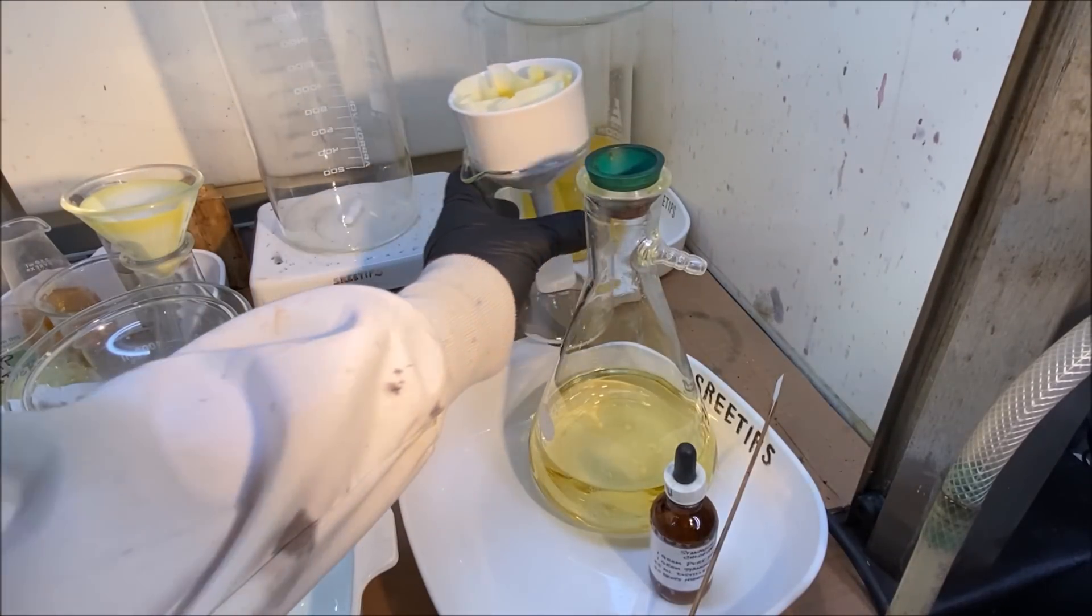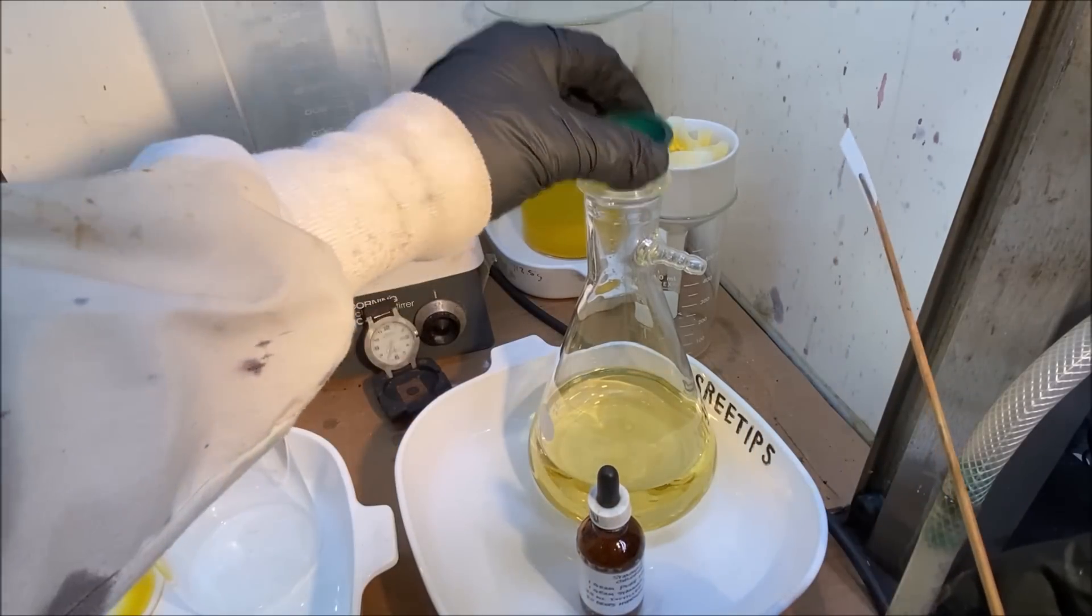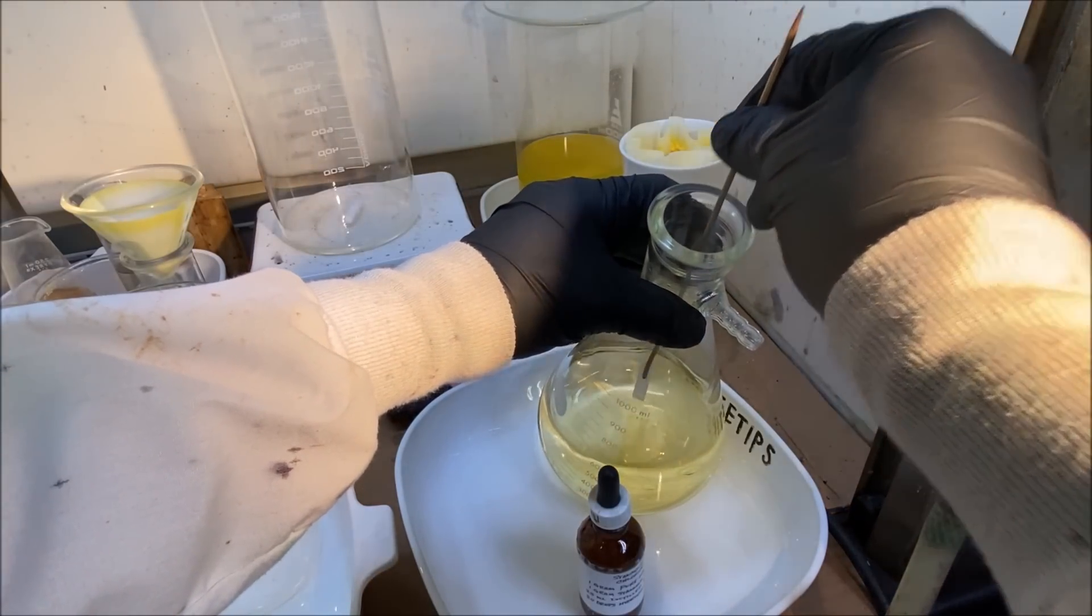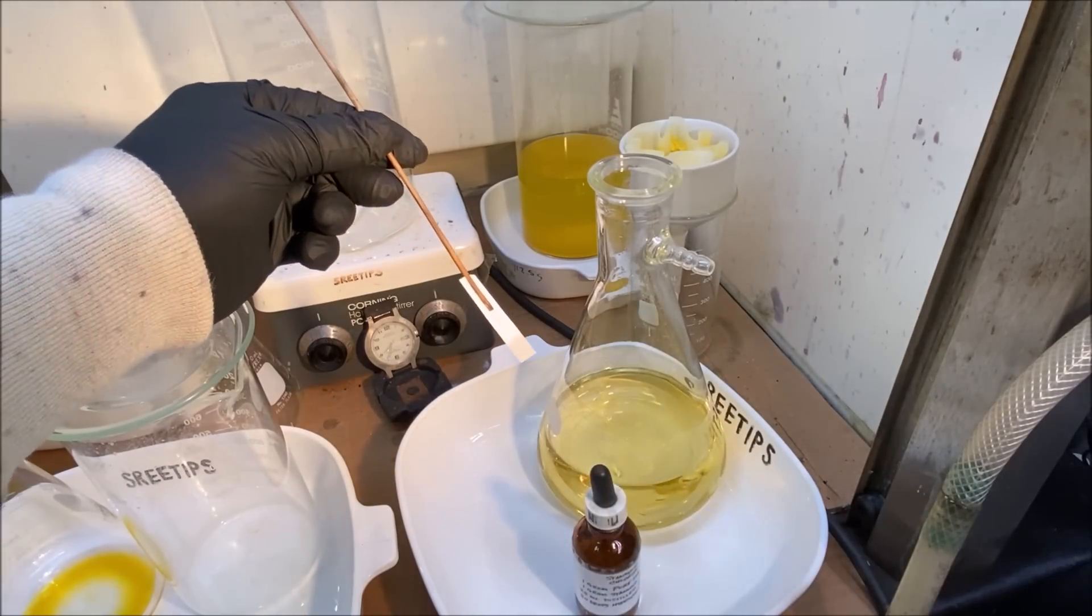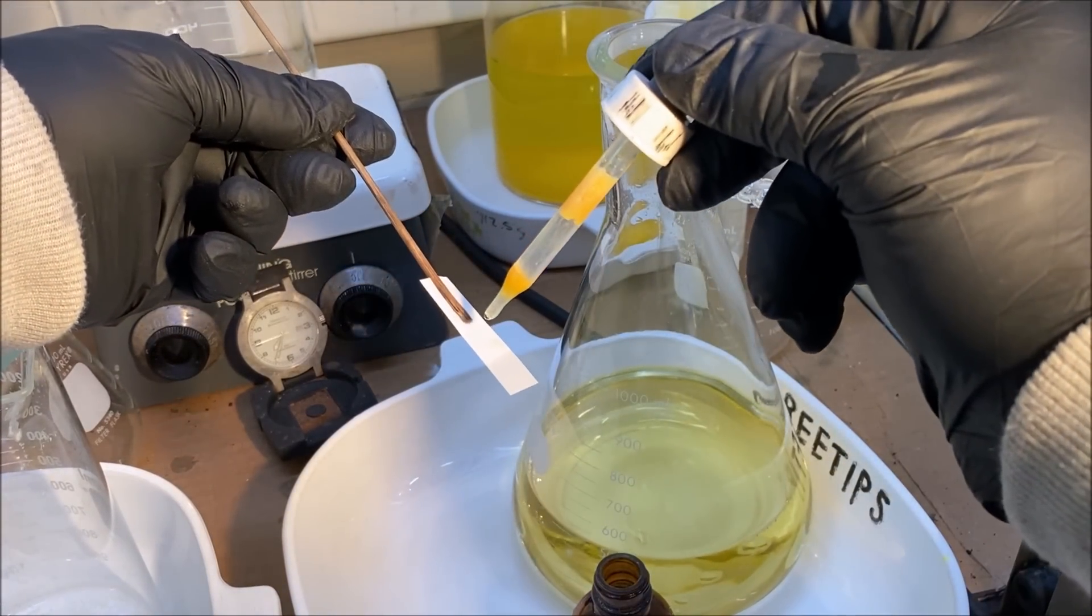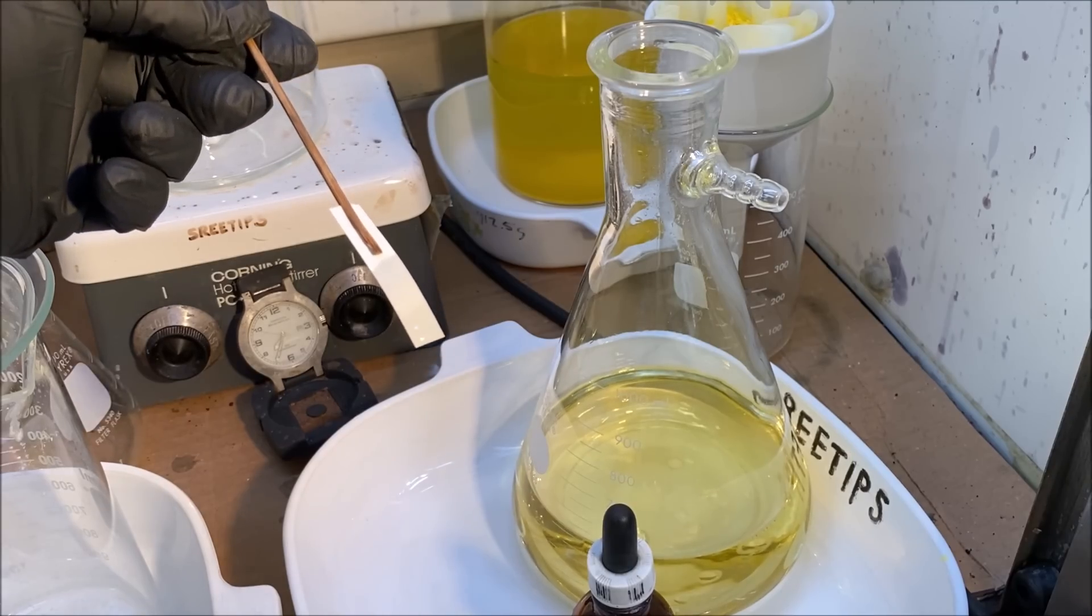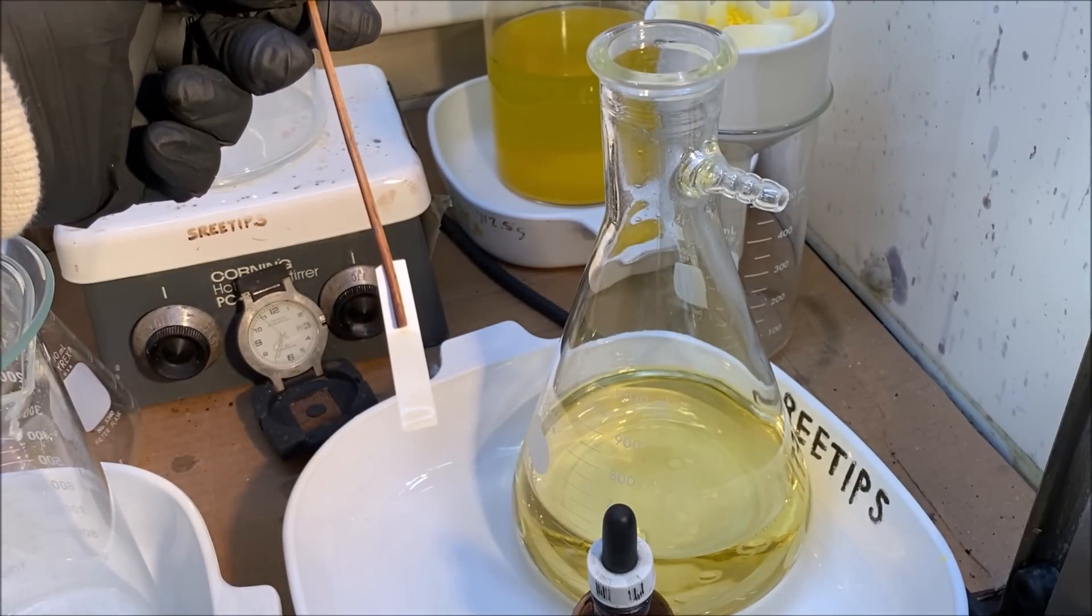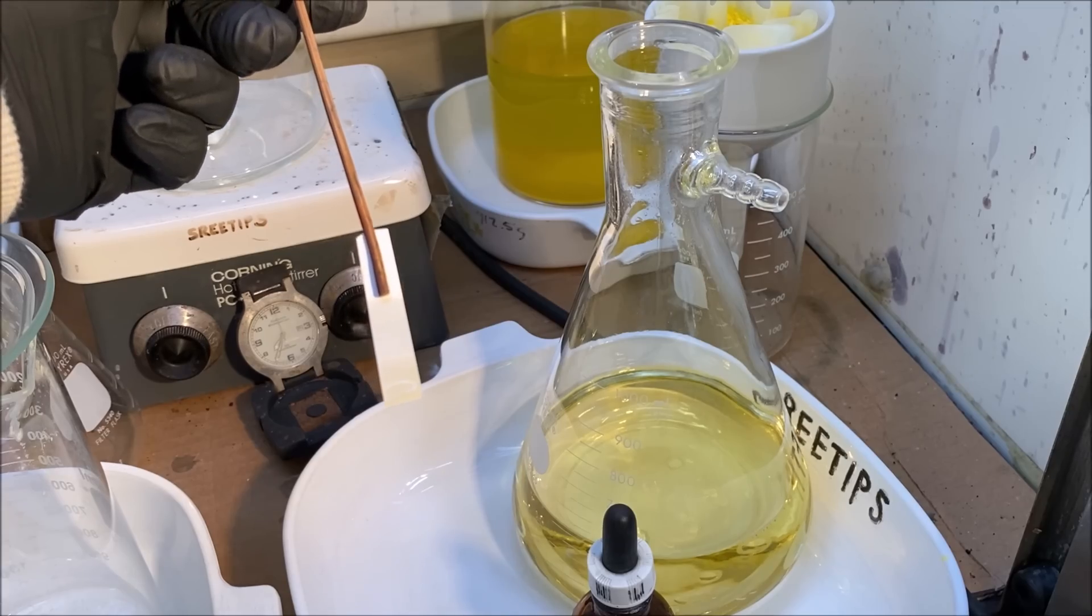What I'm going to do now is just set this back out of the way. I'm going to reach down in here with a piece of filter paper. Get some of this waste solution on here. Let's check this to see if we've got anything left in solution here. There you go, as you can see, very little if anything left in that waste solution.